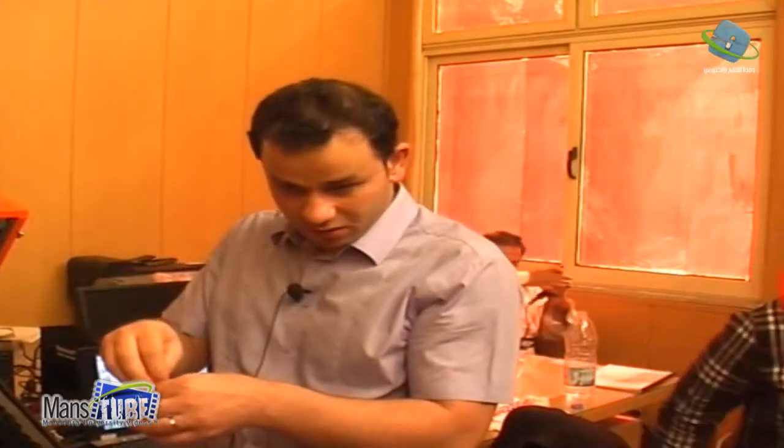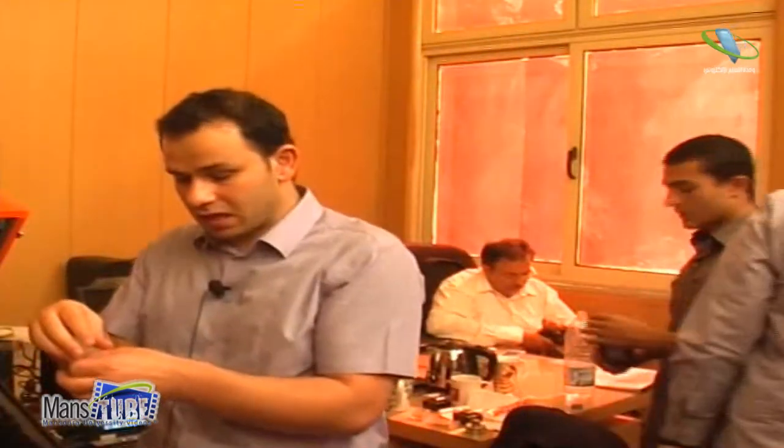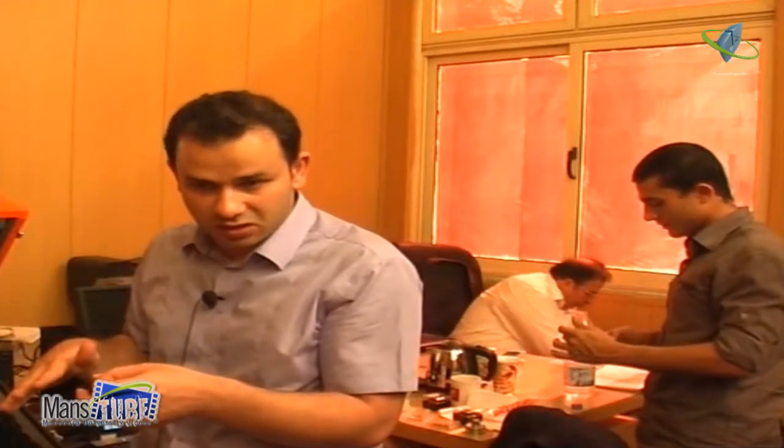Okay? But you have to let it, I mean, the particles need to stick on the surface. Okay? And to stick on the surface, there are two ways of doing this. Either you put it and let it dry, or you put in the solution, let's say a particle solution, and usually the surface is sometimes charged. You use what we call a buffer solution.